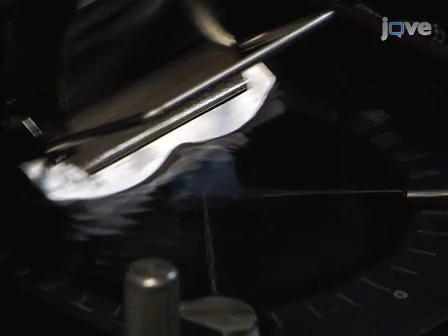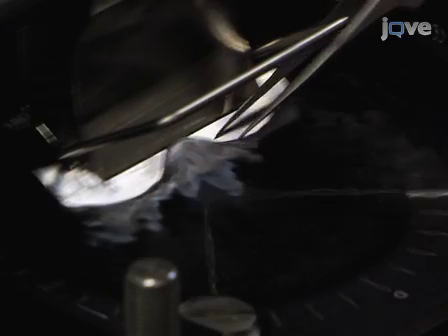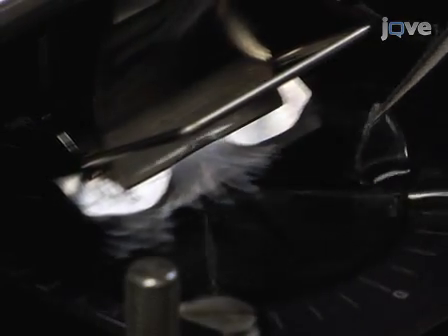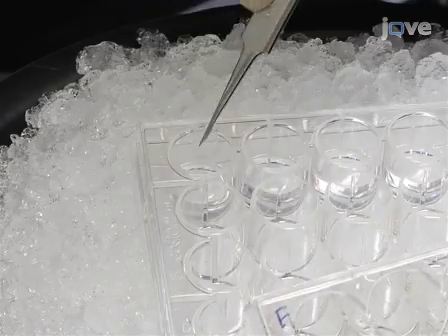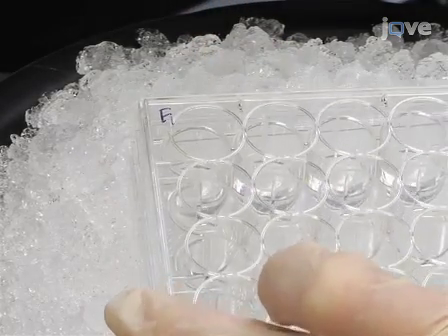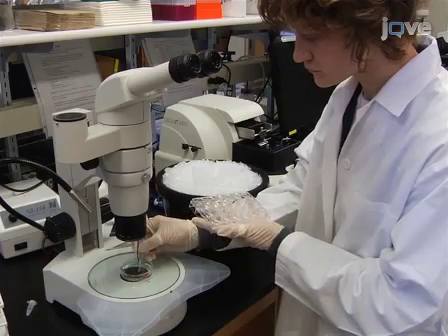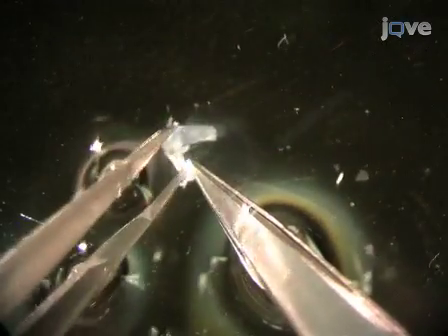While cutting tissue sections, use blunt forceps to transfer each section to a 24-well culture plate filled with half a milliliter of ice-cold PBS-tween. After slicing, remove most of the agarose from around each tissue section using spring scissors.